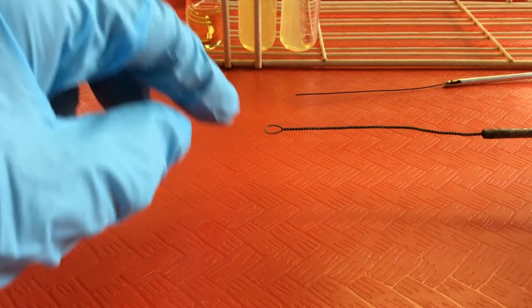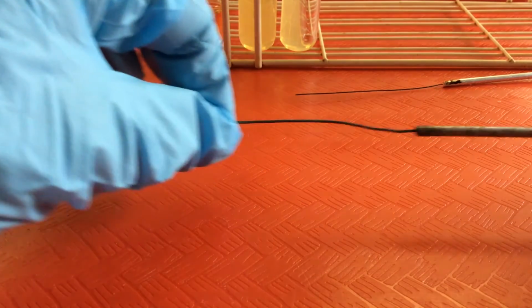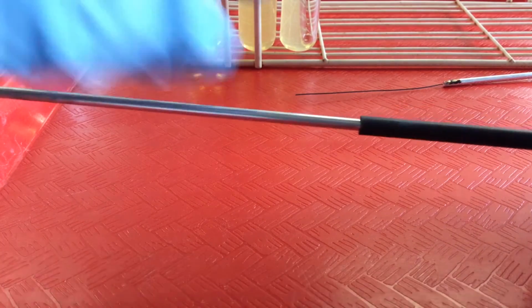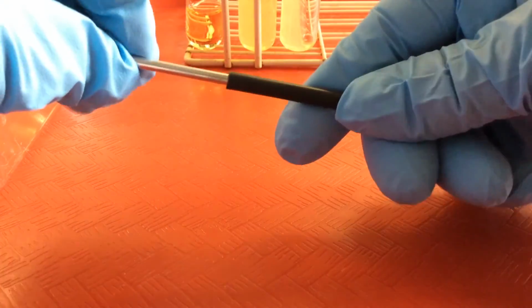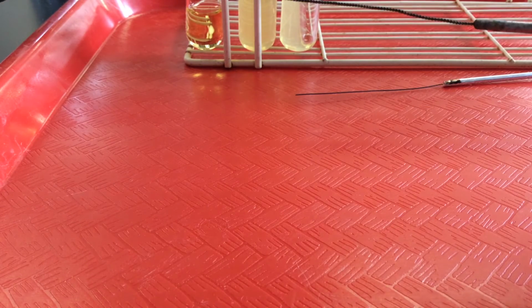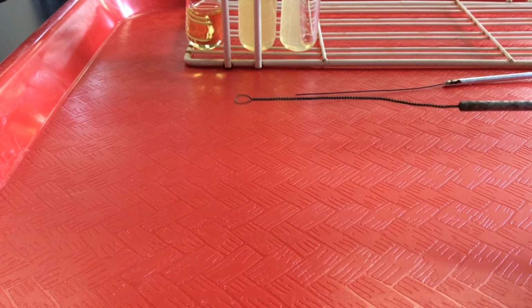And then I'm going to do a no-no here. I'm going to grab the loop just so you can see the rest of the inoculating loop. You can see there's a metal handle here. Okay, so we're always going to use the loop holding the handle here. We never use a loop holding the actual loop part here. And indeed what we're going to do when we're transferring microbes, again, we want to avoid contamination with unwanted environmental microbes.